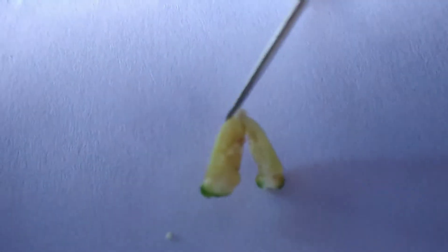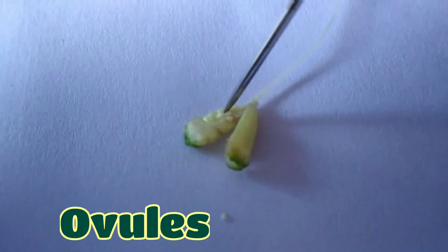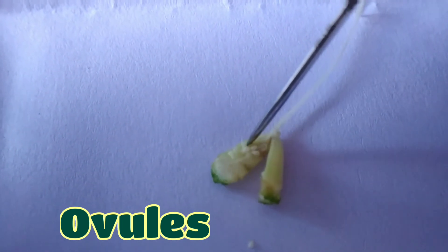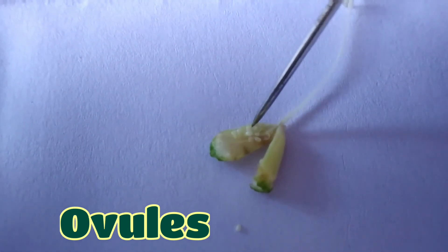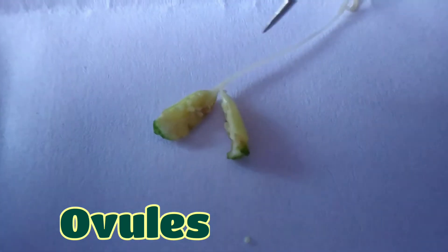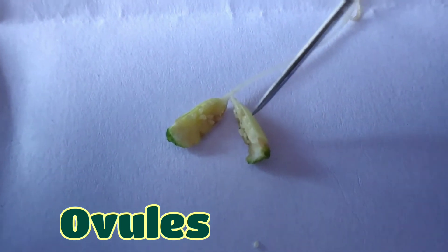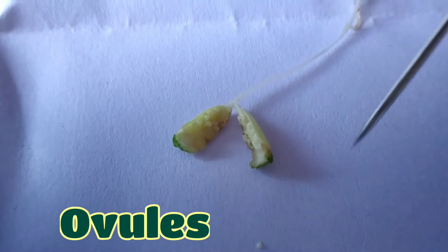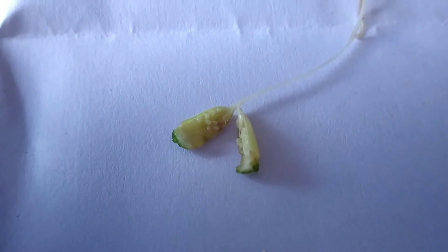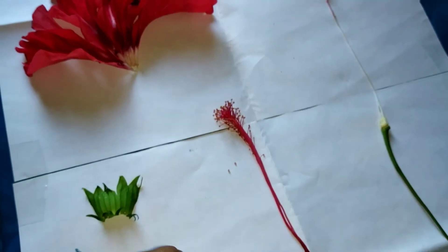Students, you can see here the ovaries. The small granule-sized objects you can see — these are the ovules inside the whole ovary. It is very sticky. After germination of the pollen grain, the ovary turns into fruit and the ovule turns into seeds, in fruit-bearing plants.